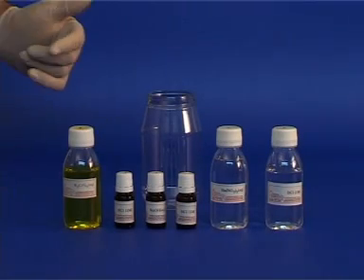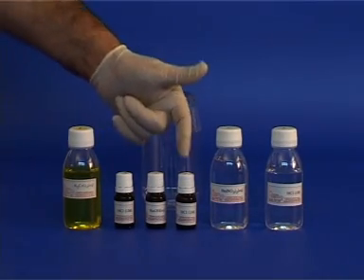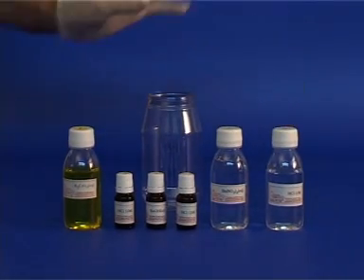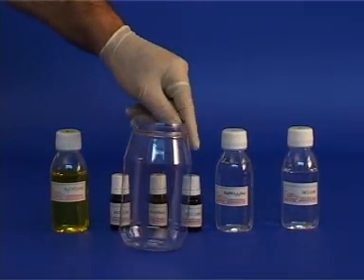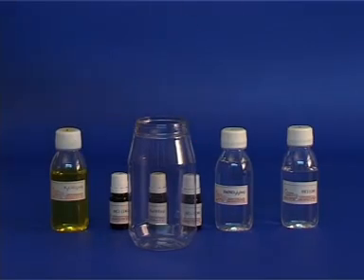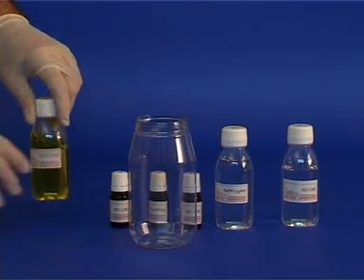We have six various sized bottles numbered 1 to 6 marked on their caps. The reaction will be performed in the empty container in which we shall observe the chemical equilibrium of the chromate-dichromate reaction.